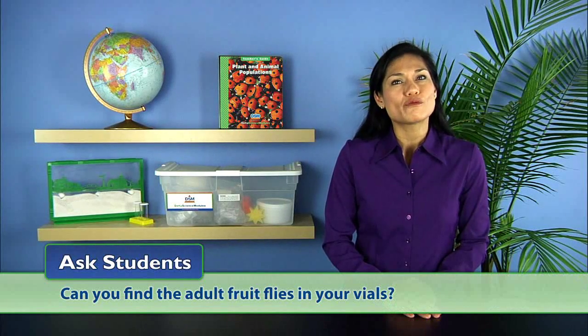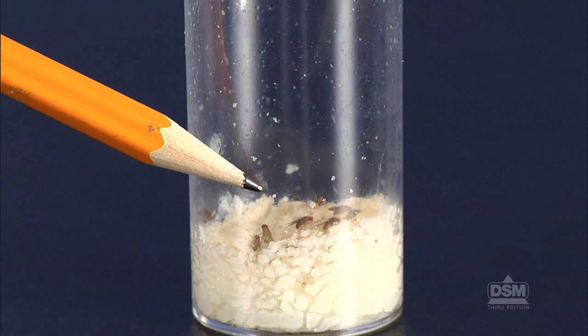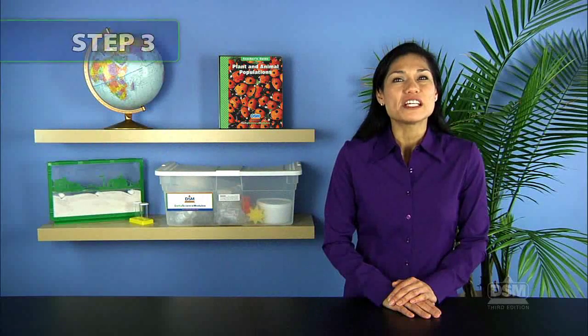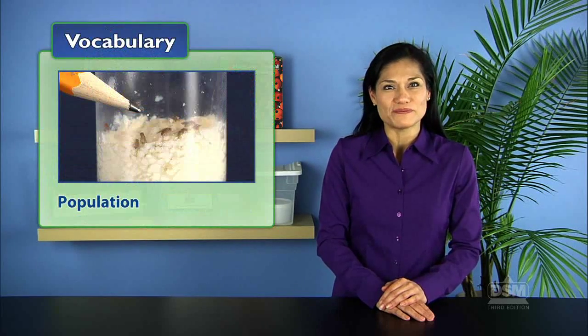Point out that the adult fruit flies have wings and ask students, can you find the adult fruit flies in your vials? Help students understand that depending on the stage of development of the fruit flies in the vials, adults may or may not be present at this time. Next, have teams count how many adult fruit flies are in their vials and record this number in the chart on the activity sheet. Remind students that the total number of one kind of plant or animal in a particular area is called a population.